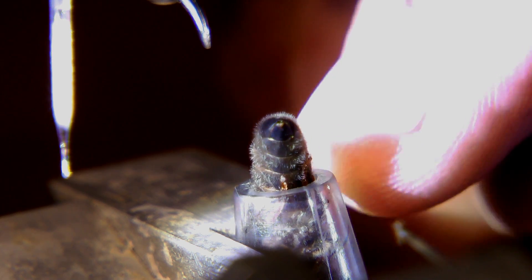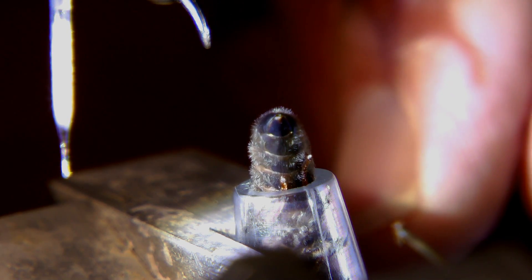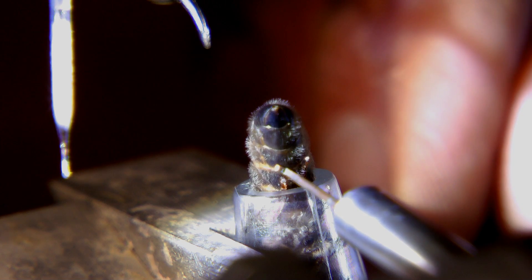That's the syringe with the semen on the left, the forceps coming down top-center and the hook coming up from the lower right.